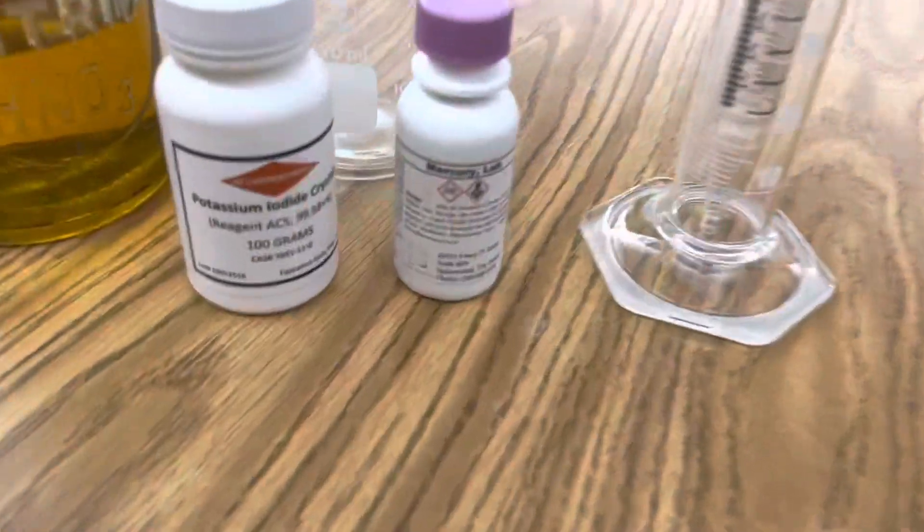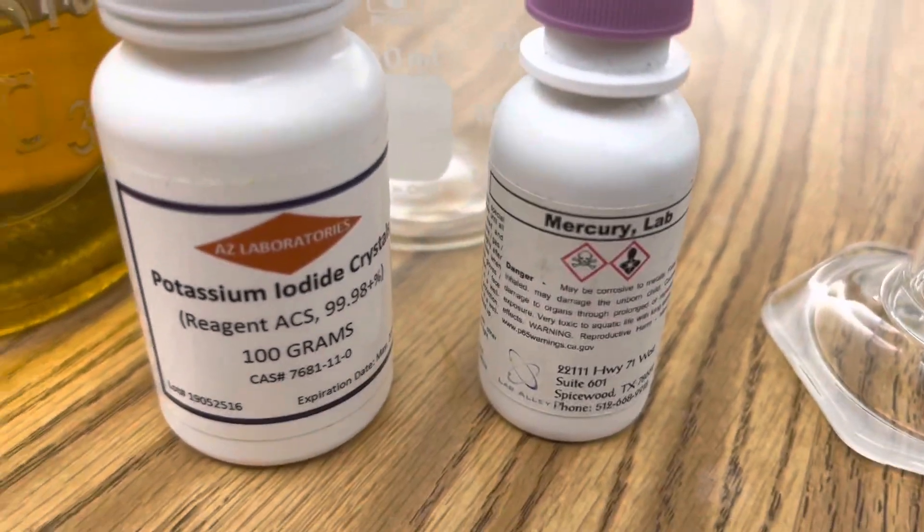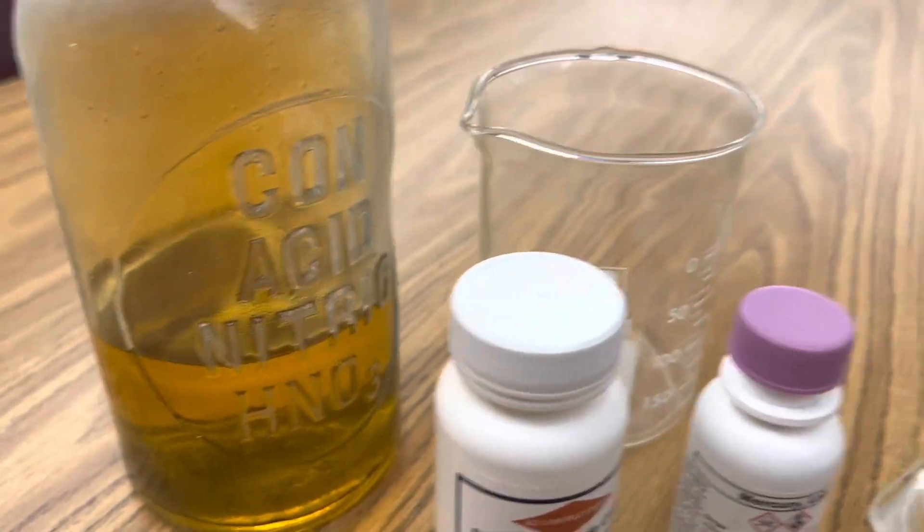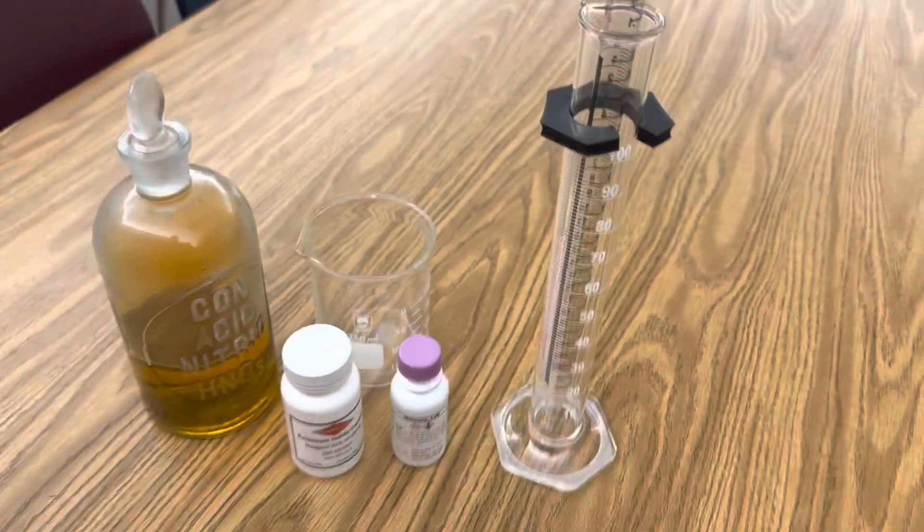So all I'm using in this lab is mercury, potassium iodide, nitric acid, a beaker, a graduated cylinder, and a dropper.